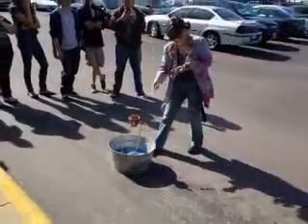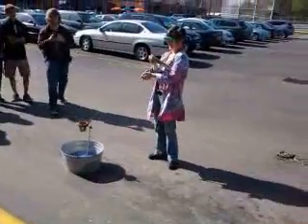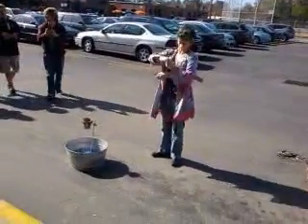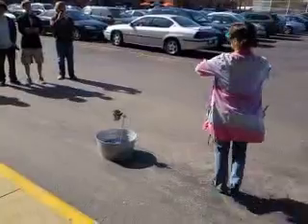Oh, God. We're dealing with a pyromaniac here. Yes, please. Good plan. Alright. There we go. You go. You wait for it to burn out.